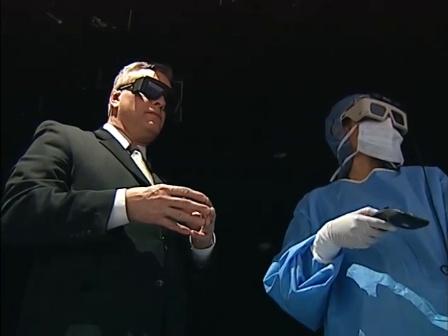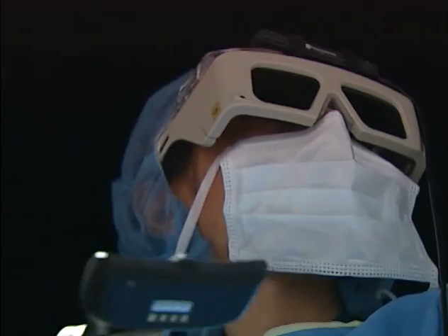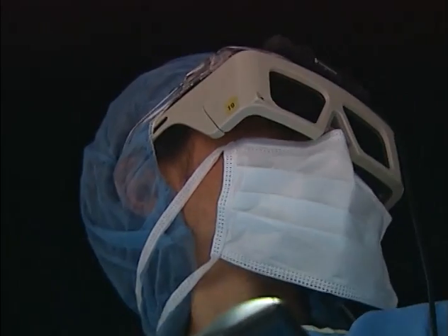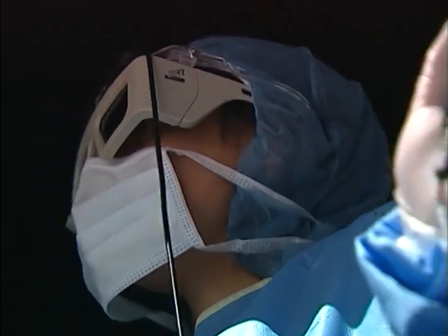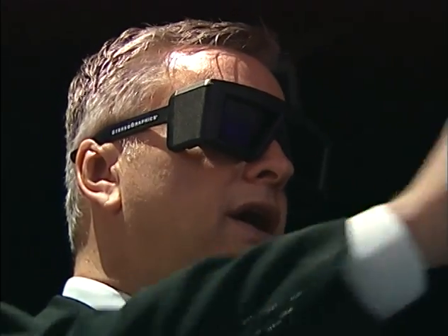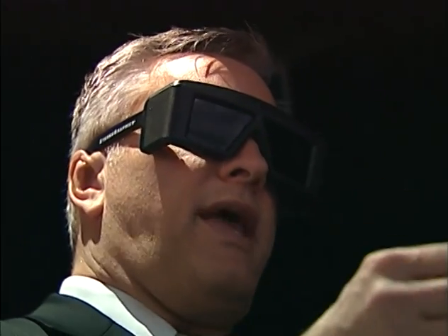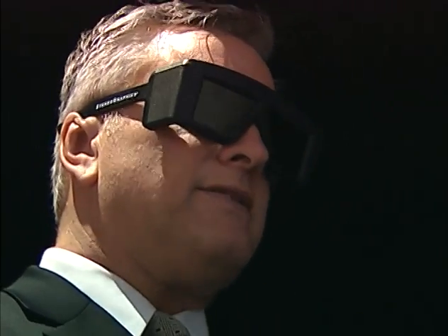Well, I see that there's a lot of needles coming out of this waste container. Is that appropriate? No. Well, are we allowed to have a Coke can? It looks like the Coke can shouldn't be there, isn't it? There is a Coke can in the refrigerator, and despite the fact you're working with the syringes or needles, you're not ever crossing your body with those. So in other words, if you're right-handed, you would want to have your bin here, or you would want to have your hazardous material bin here. Similarly, if you're left-handed, you would want to move it over so it's on this side, so you're always moving.